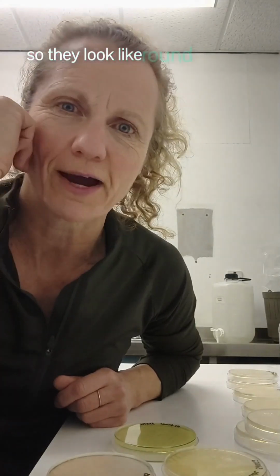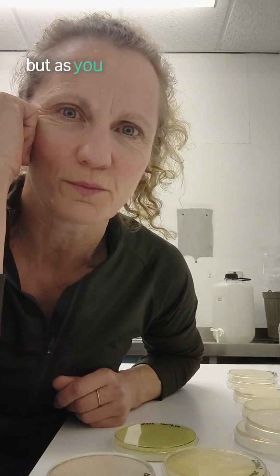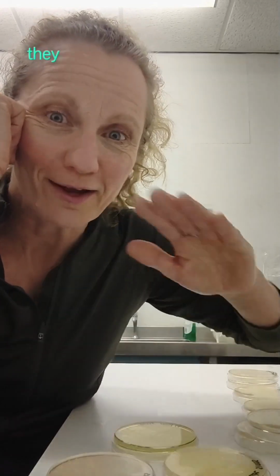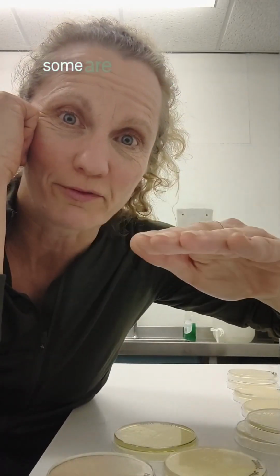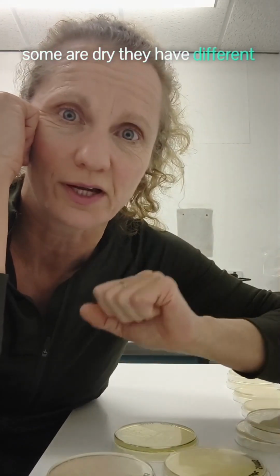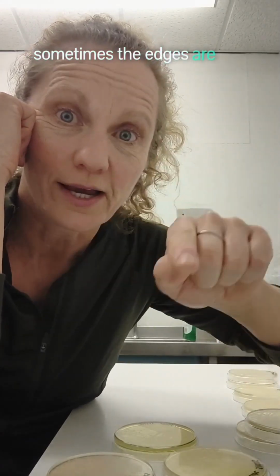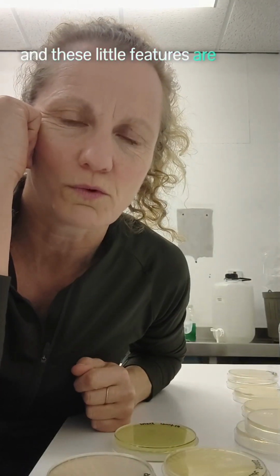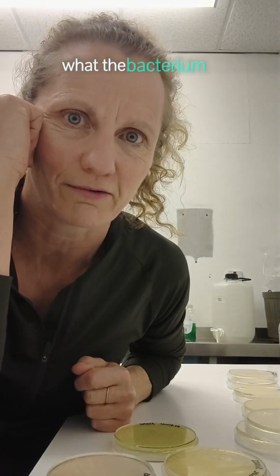So they look like round blobs to most people, but as you work in microbiology, you get to know that the round blobs aren't just round blobs. They have different topography. Some are round, some are flat, some are wet, some are dry. They have different colours. Sometimes the edges are smooth, sometimes they're irregular. And these little features are what we use to determine what the bacterium is.